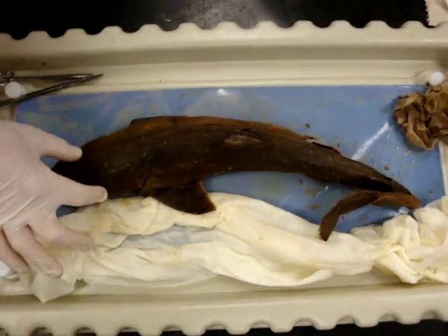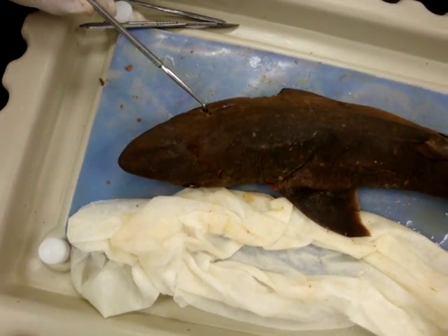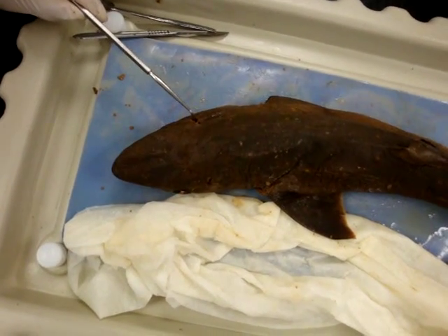There are a couple of holes in the top of the head called spiracles. They allow for the exchange of water into the pharyngeal cavity while the shark is laying on the bottom, so it can still breathe and bring water in without getting a mouthful of sand.